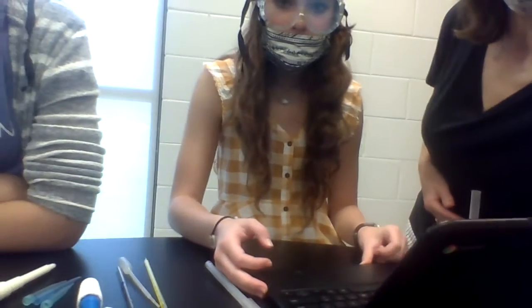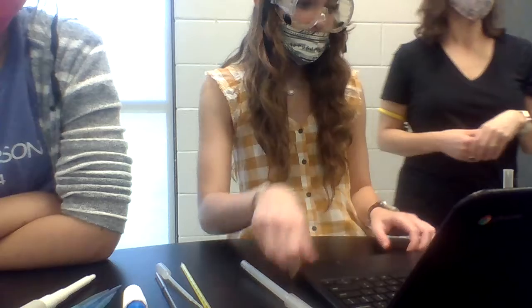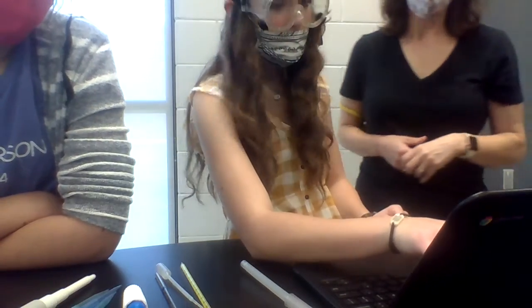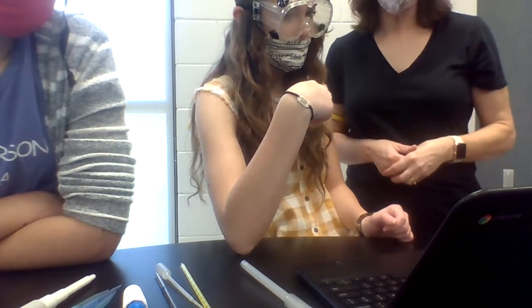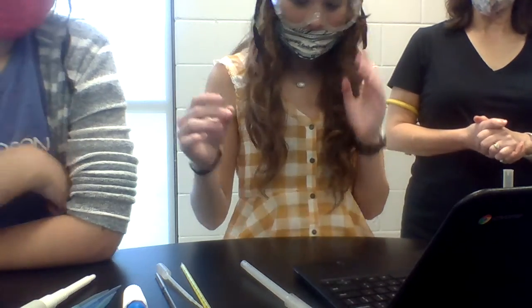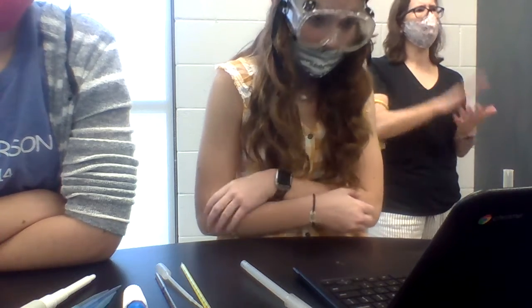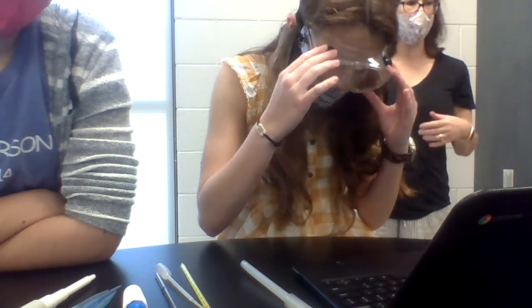Can I put this over here? Do we go ahead and do the density and average? Working with those? Yes. So is that right? That looks like what you're supposed to be doing, yeah. All right. I wouldn't do the density or the average right now. I would focus on getting the data. You can take averages and do densities.